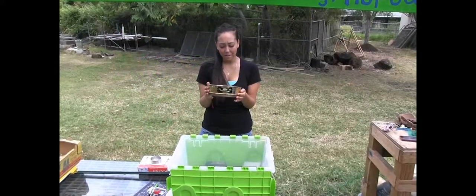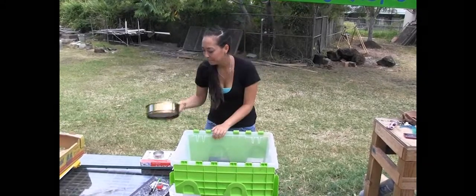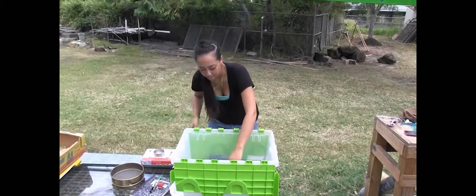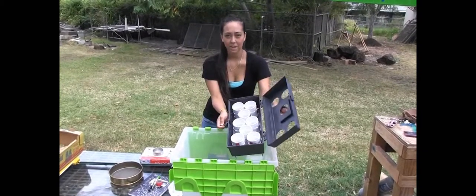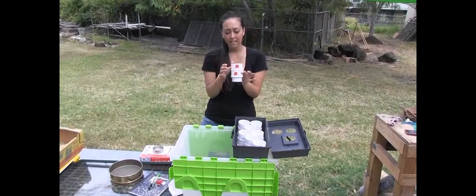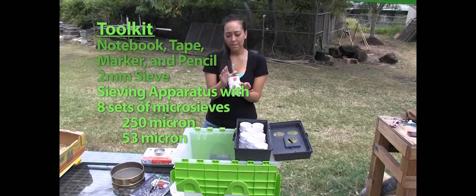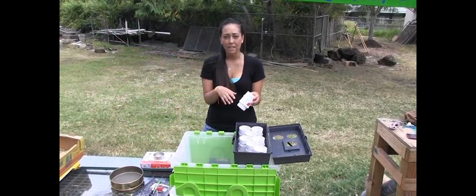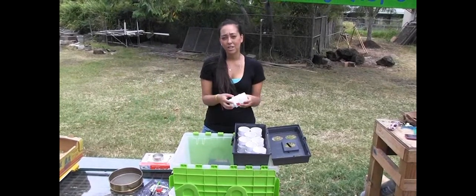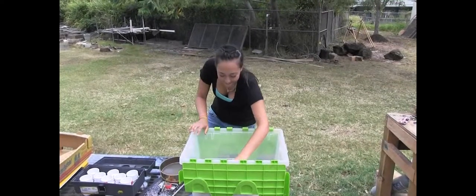That's because as we all know, anything greater than two millimeters is not considered to be soil. This here is the sieving apparatus — inside you can see we have our eight sets of sieves. Each sieve is a pair set and we have a 250 micrometer sieve and a 53 micrometer sieve. We use these two class sizes of aggregates because in published literature it's those two class sizes that show the greatest change due to agriculture or land use changes.